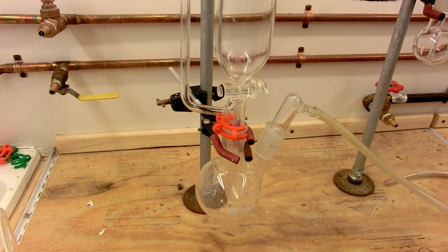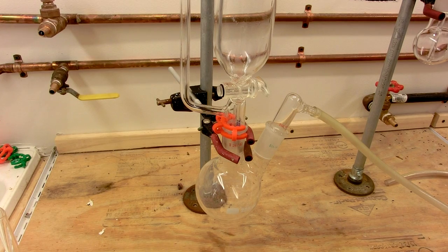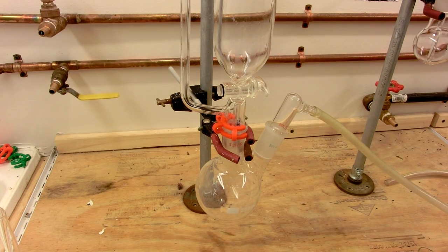So to construct the chlorine generator, we'll first build the apparatus, of course, that's already done. And then we're going to charge the reactants into the generator.